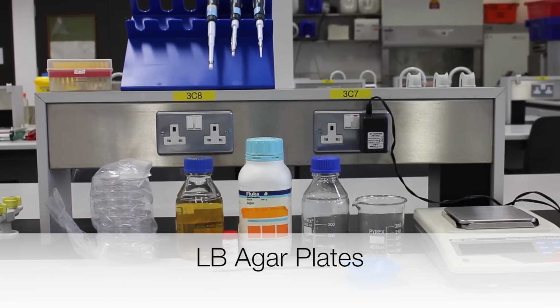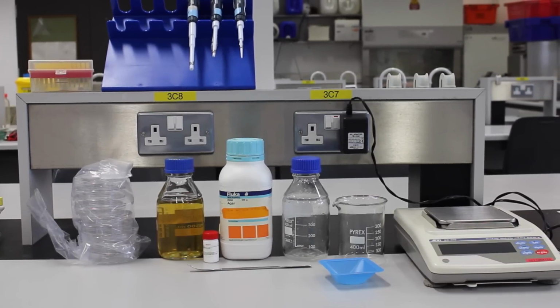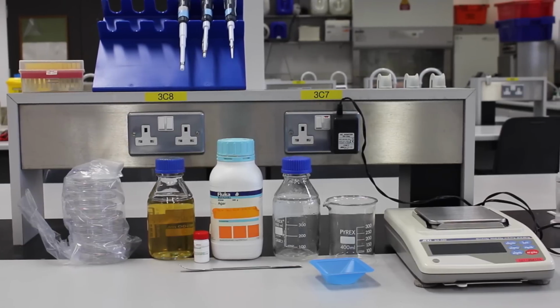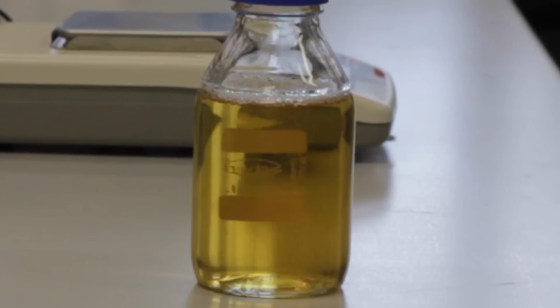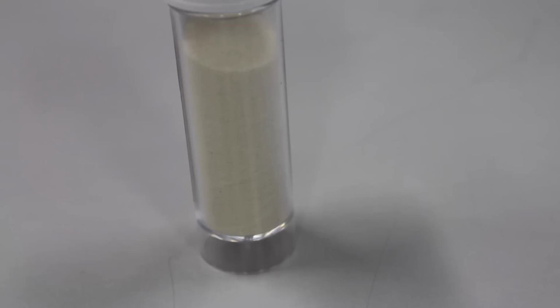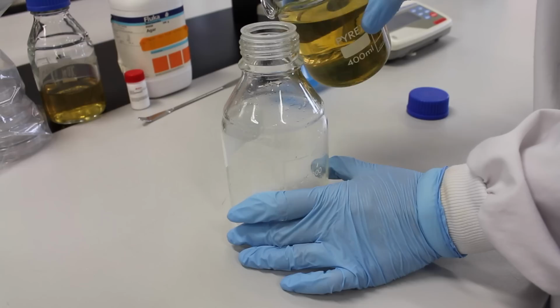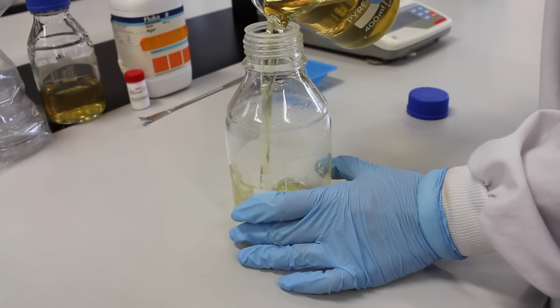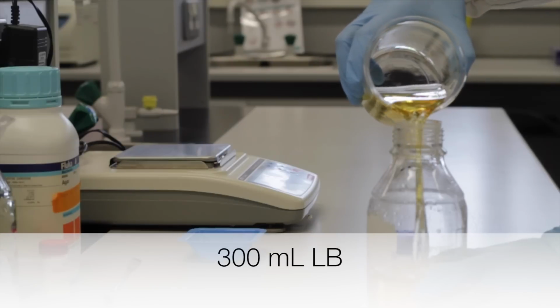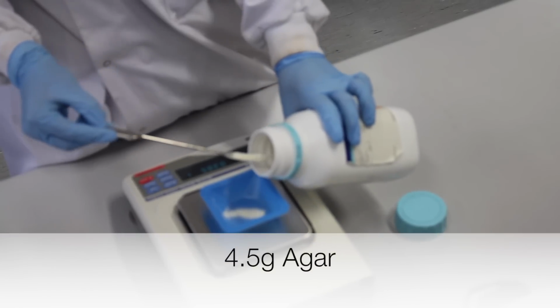LB agar plates containing specific antibiotics allow resistant selection of bacteria. The following are needed to prepare agar plates: freshly prepared LB medium that hasn't been autoclaved, agar, an antibiotic of choice at the right working concentration. Ampicillin was used in this video. To a glass bottle, the following are added: 300 milliliters LB prepared fresh that hasn't been autoclaved, and 4.5 grams of agar.